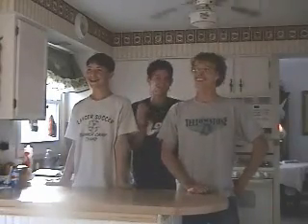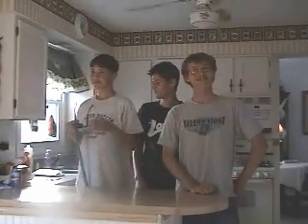So Chris, that was an interesting experiment, wasn't it? Indeed it was, Kevin. That yellow film was really amazing. Yeah, it was really cool. So, what happened? Well, Kevin here, he wore safety goggles, so his eyes are safe and sound. But Chris, he has to wear a new kind of safety goggle.